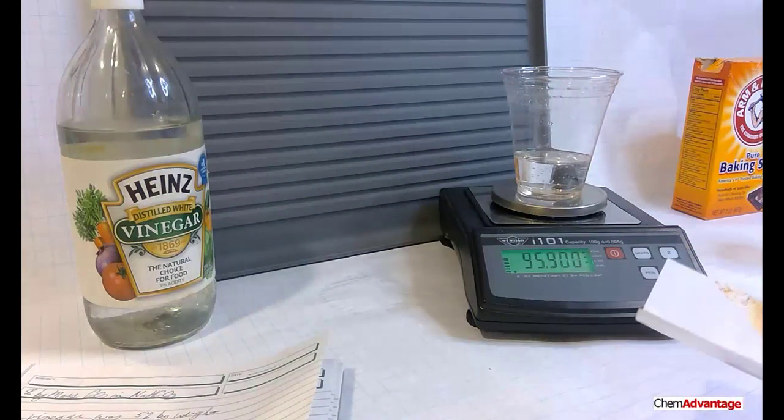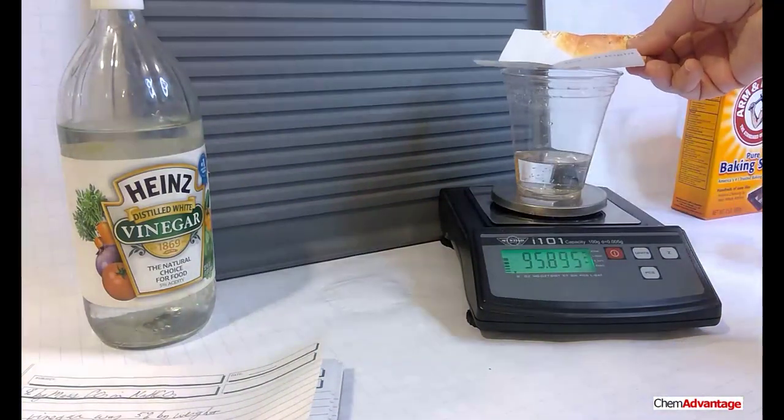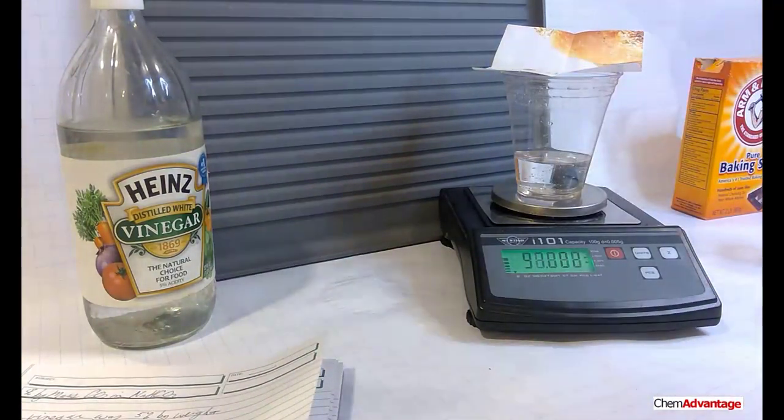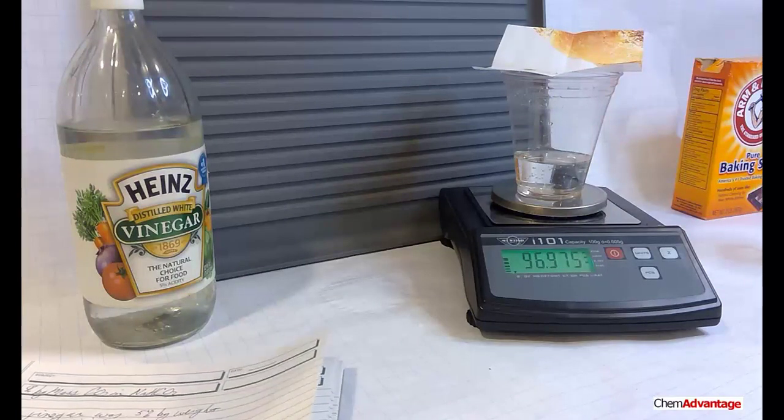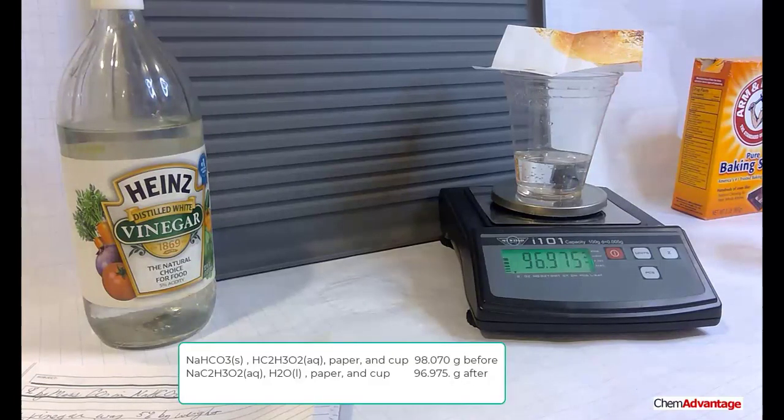This is the second time I've done the experiment, because the first time I forgot to put the paper on, because we have to know what the change in mass of just the chemicals was. Okay, I've got everything else. It used to be 98.07, now it's 96.975. The water that was produced is still in there, but the atoms that escaped were carbon dioxide, and they fizzed out, or mostly out.